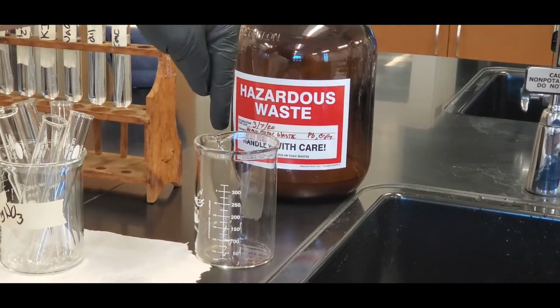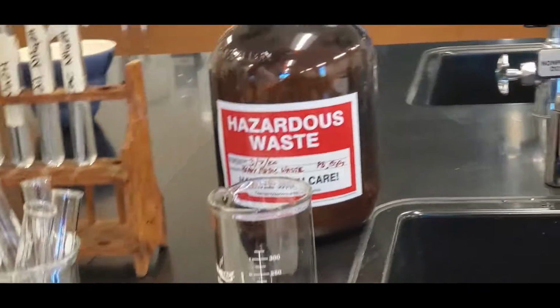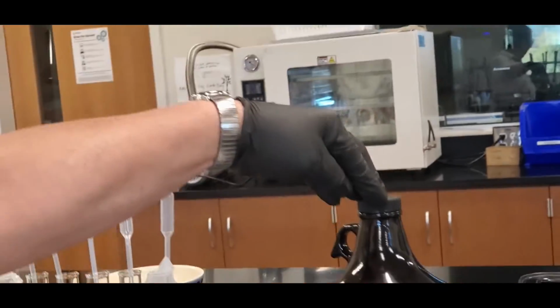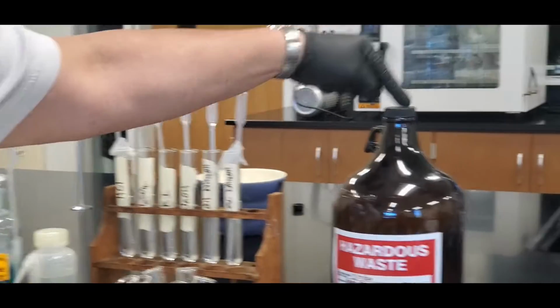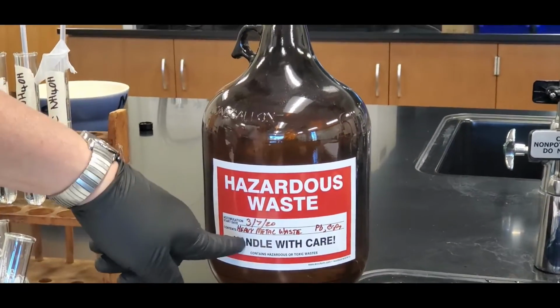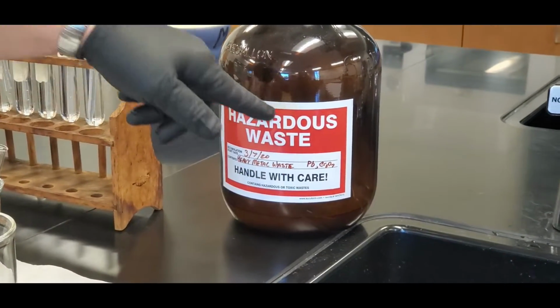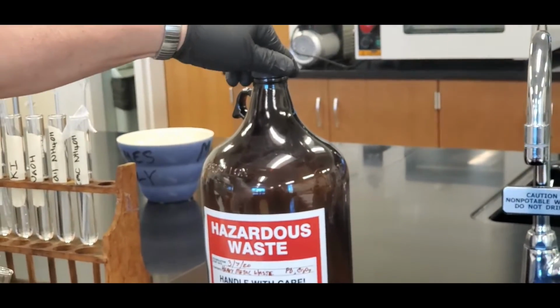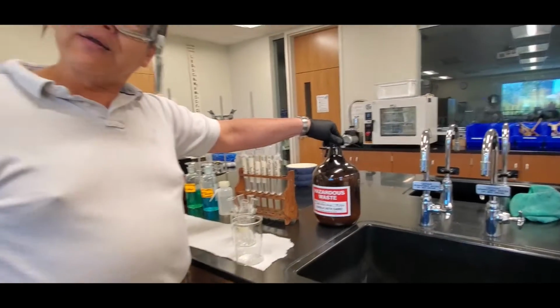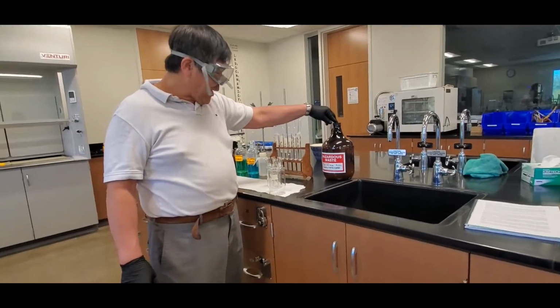and then here's a waste container. During the lab, you're going to put everything in the waste. Do not constantly go to the hood with the main waste container, because that's an accident waiting to happen. Only put it in there after class, and it should be called heavy metal waste, okay? Do not put it into any other container. Also, do not generate a ton of waste, because here at FK we're being legally ripped off, in the sense that this is going to cost us about $1,000 a bottle, okay? Anyway, so here we go.